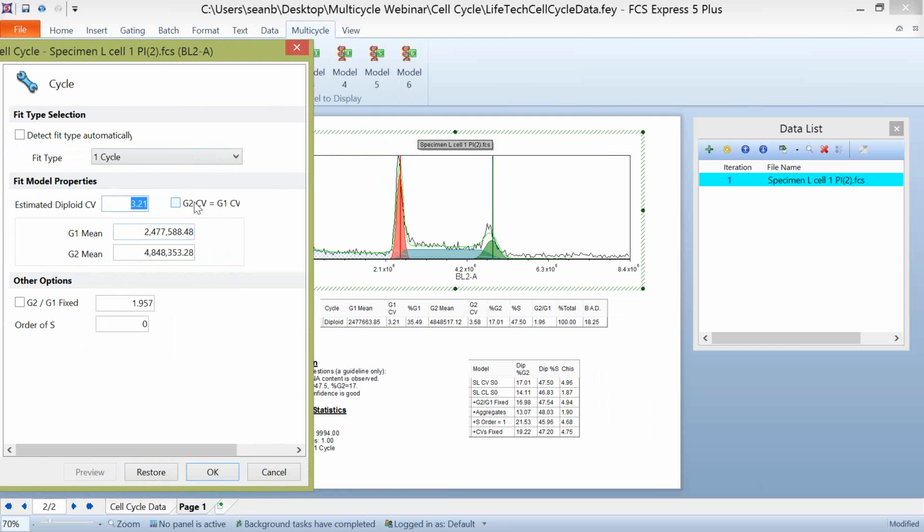But there's an option here to also set the G2 and G1 CV values the same. If I choose this option, it's going to assume that for our data, the G1 and G2 CVs have the same spread. This may or may not be of use to you in a certain case, but it is here for you to define if you'd like to change that.